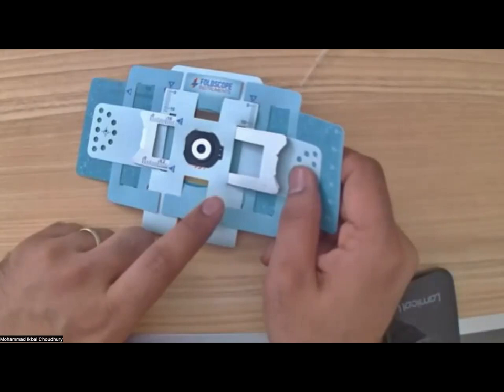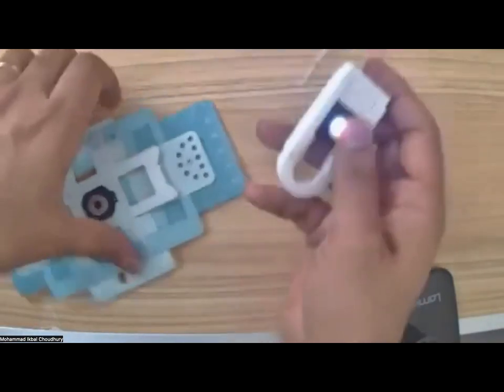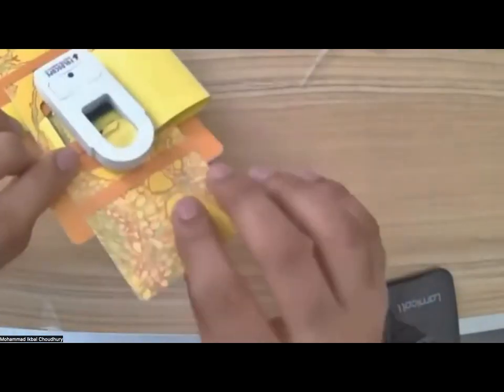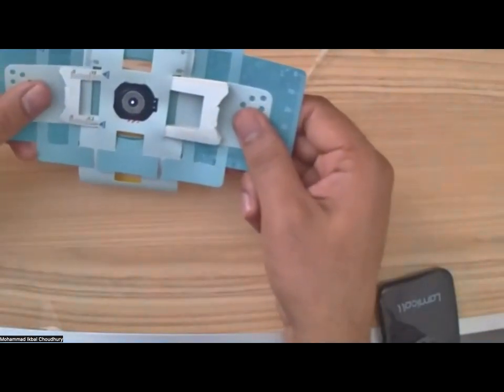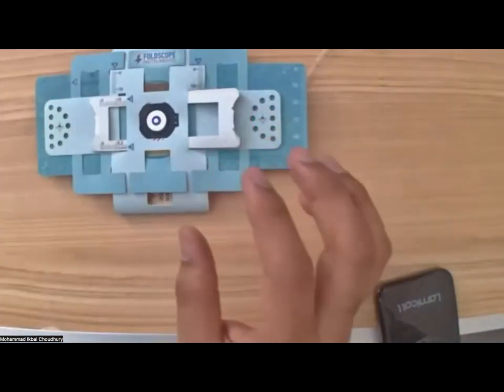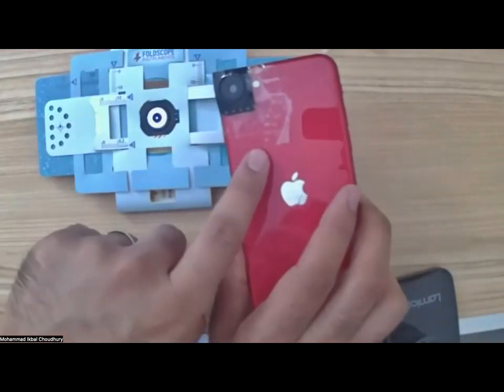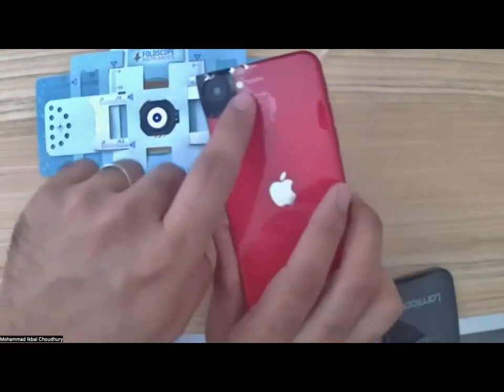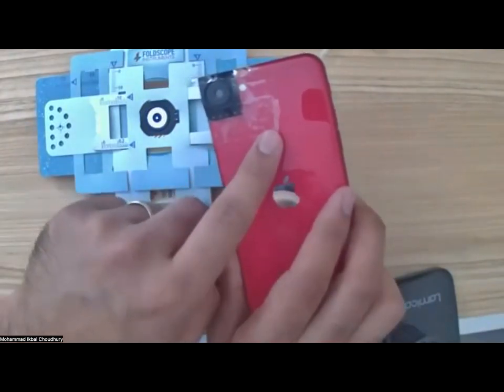If you don't have a light source, if you're indoors and you can't see through, just connect this light source, maybe at a lower setting. This is the high setting, low setting here. And this one is easy, right? It just settles there. You don't have to do much, and just observe with your eyes what you see through the sample. Then connect the cell phone to the adapter first and then to the microscope. That requires a bit of skill, but I'm sure within a week you will be able to do it.